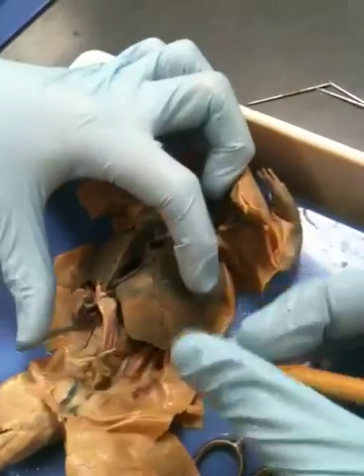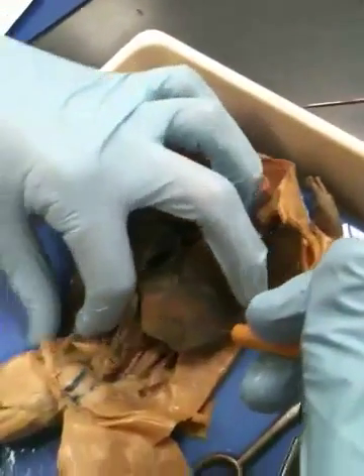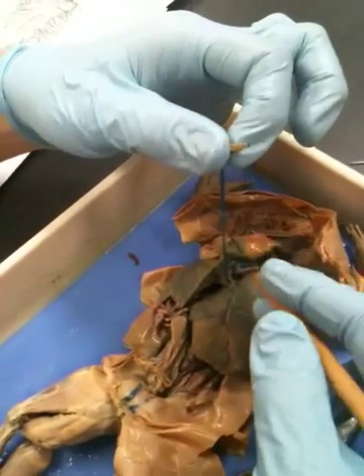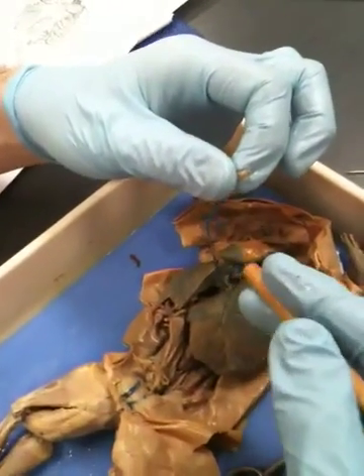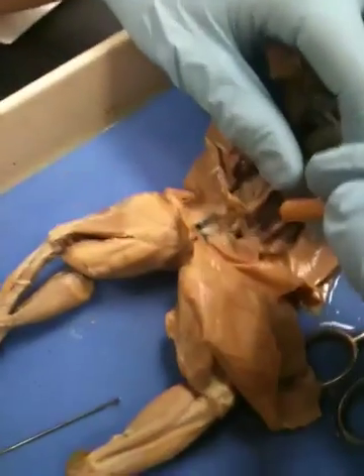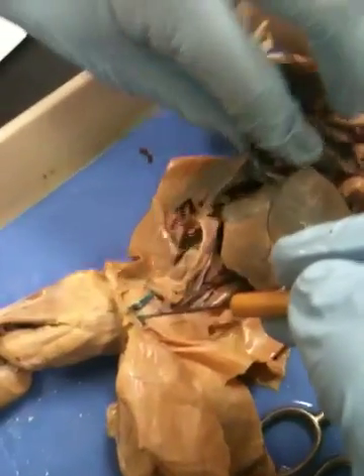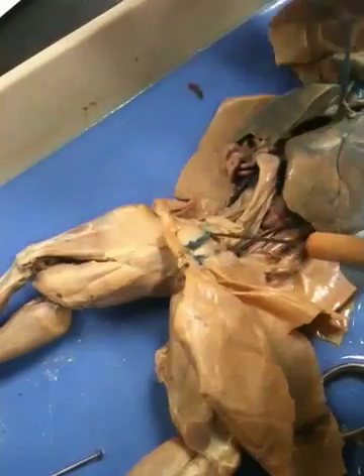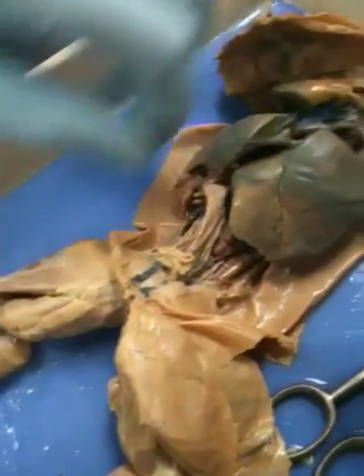All right, so I'm not too sure about a lot of these things. This wasn't a very good injection, so we're going to just try. First off, I think this is the ventral abdominal vein. I'm pretty sure about that one. We know that one. Then after that, we have the pelvic veins, which is where the ventral abdominal vein used to connect to this before it was cut. So these two are the pelvic veins.